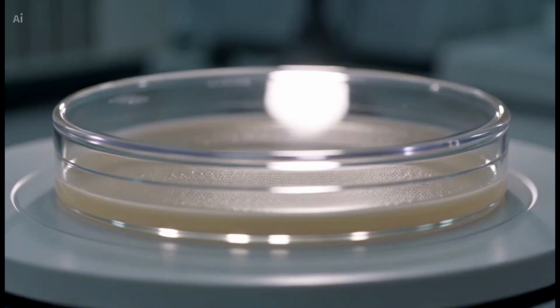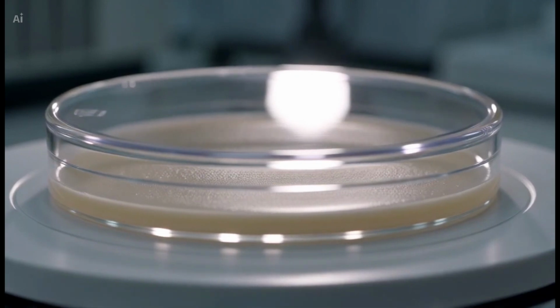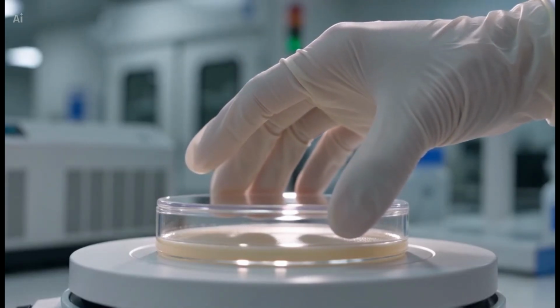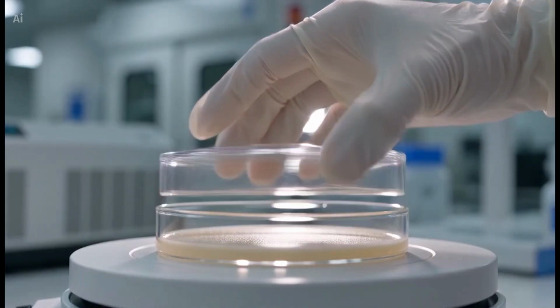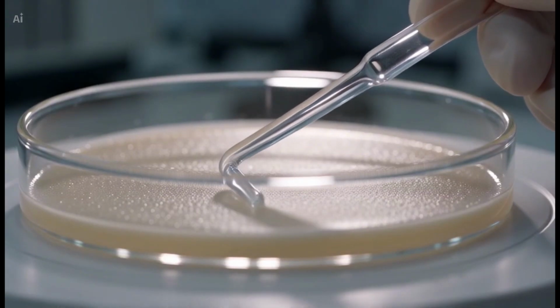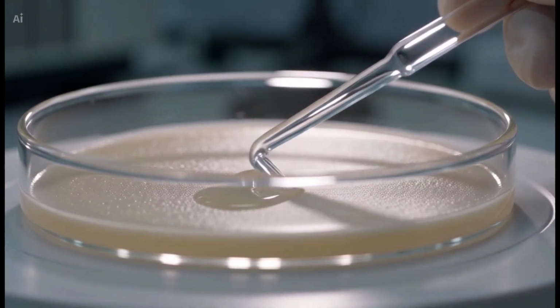Step 4. Spreading the inoculum. Slightly lift the lid of the petri plate and place it on the turntable. A turntable in the spread plate technique is a flat rotating platform on which the petri dish is placed. As it spins, the L-shaped glass spreader remains in contact with the agar surface, allowing the microbial suspension to spread evenly.